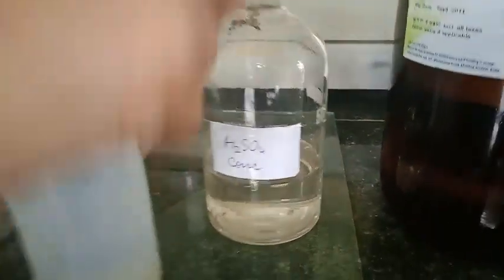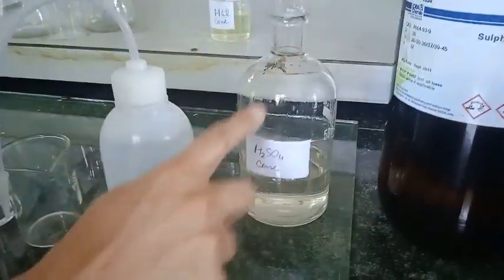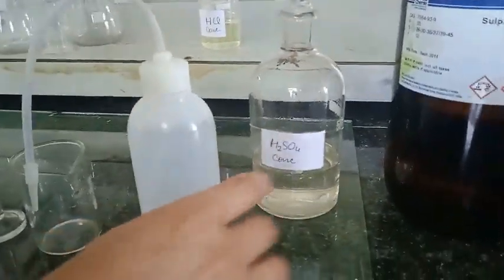Just for the sake of simplicity and safety, I have transferred some of the concentrated sulfuric acid into a bottle.